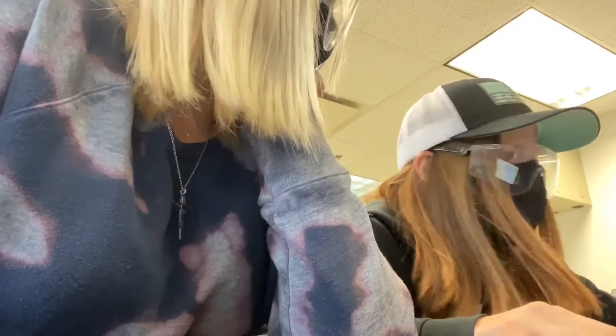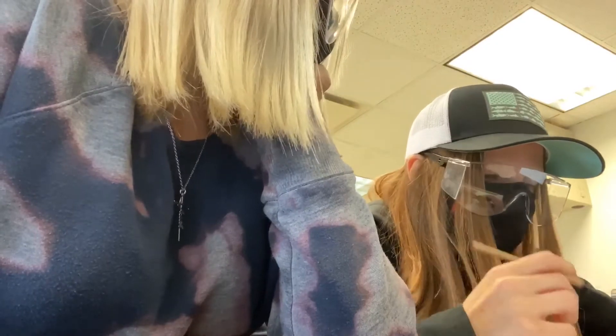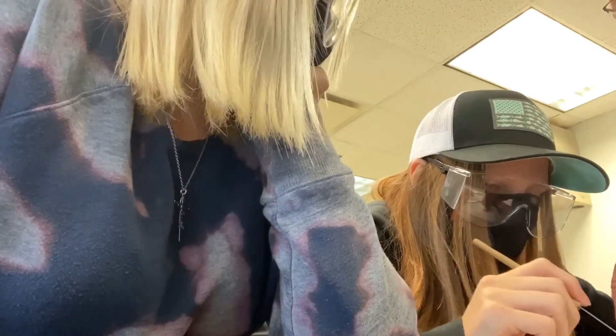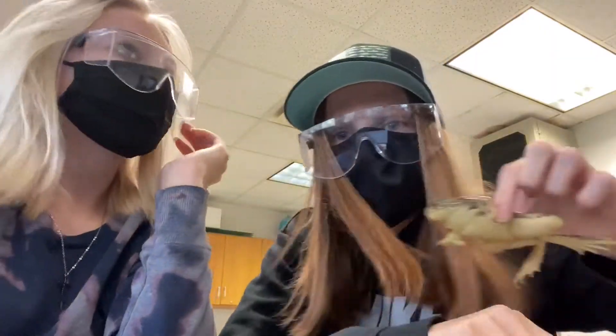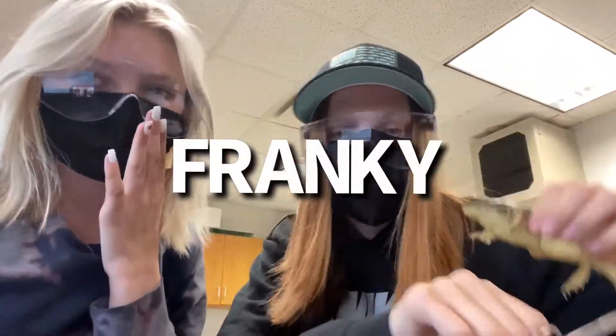That focuses the light on the retina. What should I use to get the eye out? I would cut it with the scissors and then try to pull it out with this. Okay, sounds good. We decided on the name Frankie. Let's get cutting.